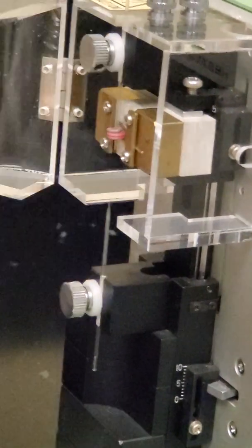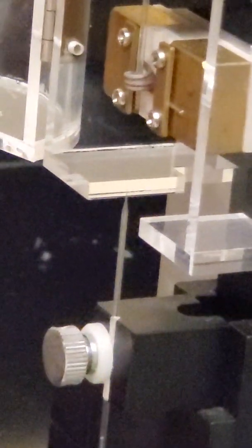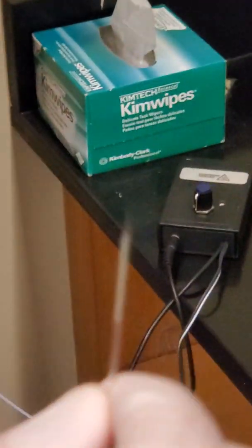And you can see now the fine tip at the end of the needle. And so you can set the machine to different heat levels to get whatever tip that you need for your procedure.